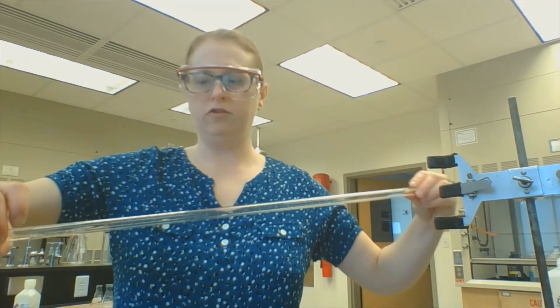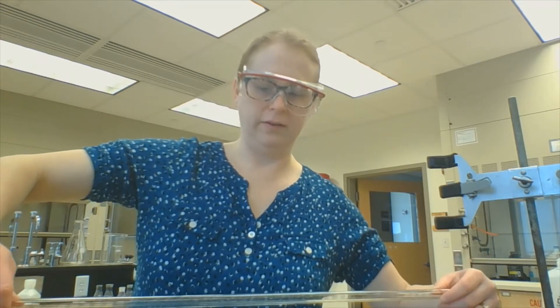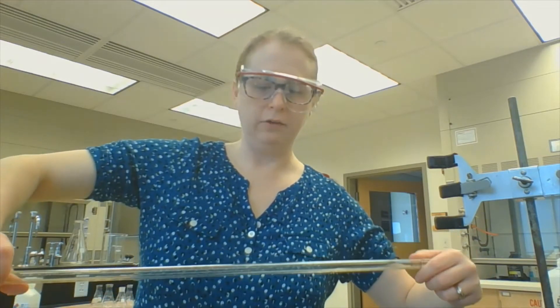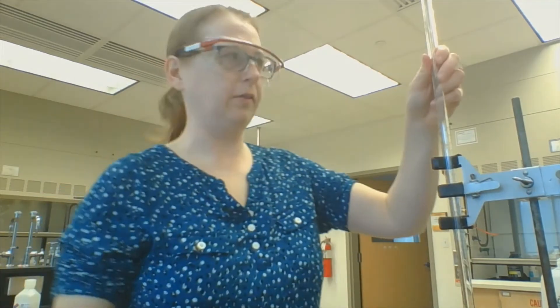I take the funnel out so I don't make a mess, then gently pick it up and turn it around. I'm trying to coat the sides with the sodium hydroxide because this burette was last used by the analytical students, who didn't use sodium hydroxide, so I need to clean it out from whatever they had. Then I pour out the top and do that one more time to get the sides.